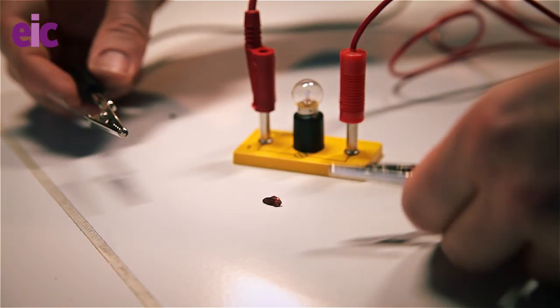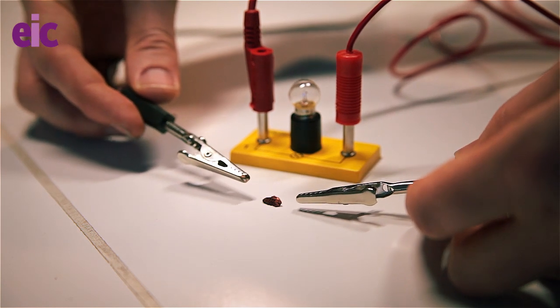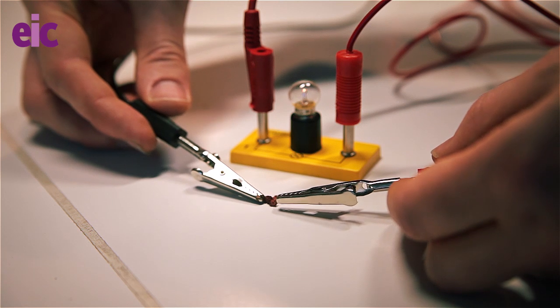Once you've allowed the tube to cool, you can quite easily remove the copper and show that it will conduct an electric current.